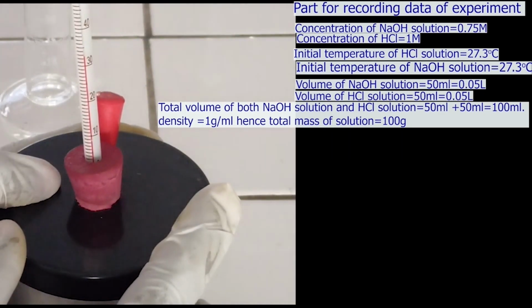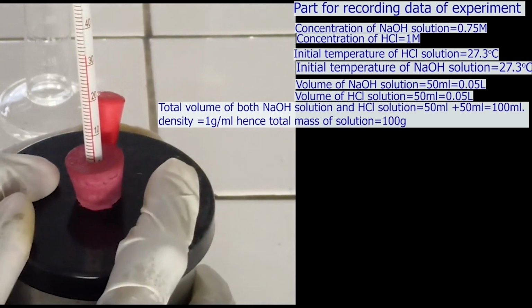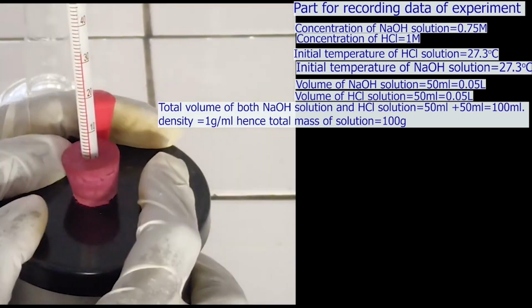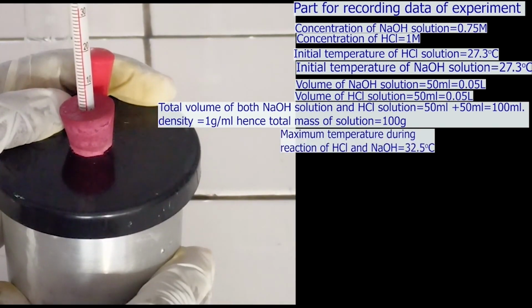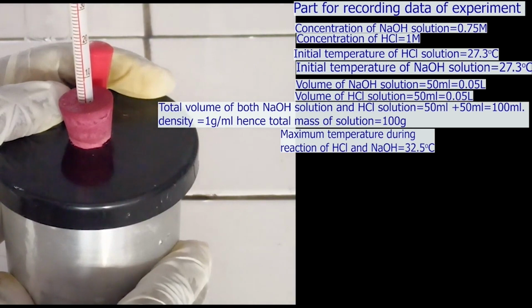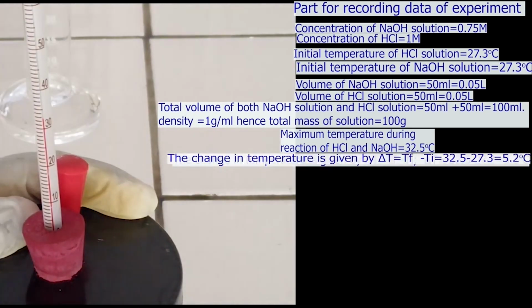The reaction between acid and base is exothermic. The heat released is used to increase the temperature of the solution. By reading carefully on the thermometer, the maximum temperature of solution is 32.5 degrees Celsius. The change in temperature is 5.2 degrees Celsius.